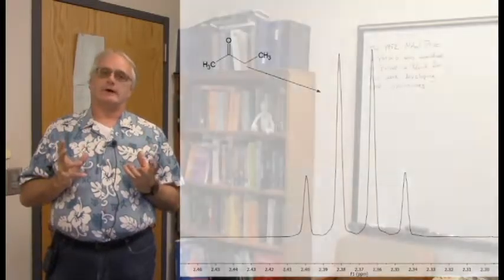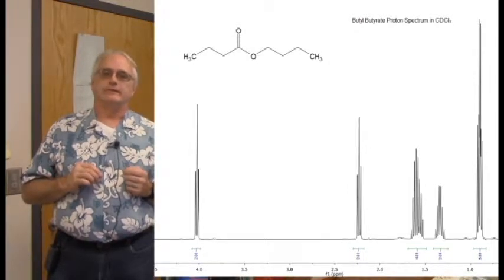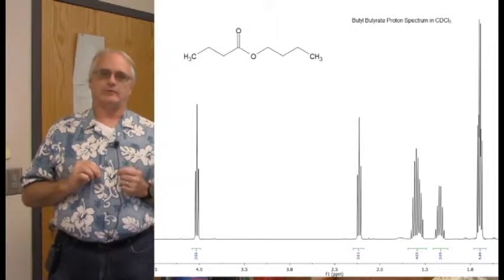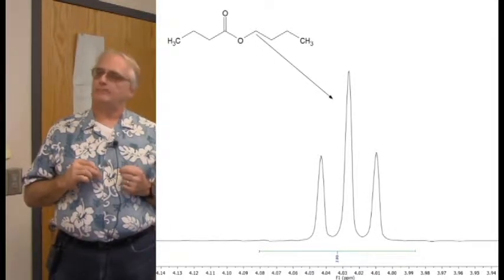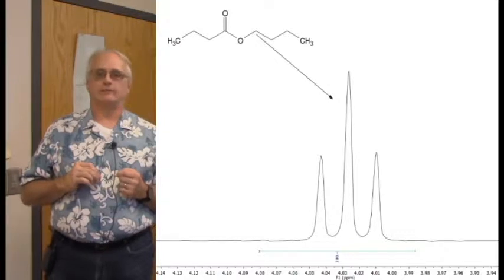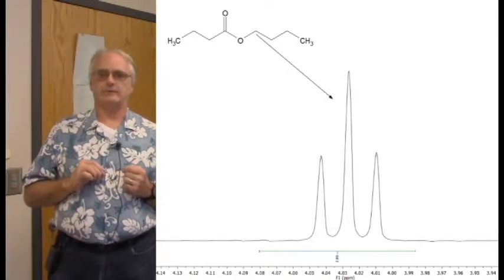And even in larger molecules, the somewhat larger here butyl butyrate, 5 methylene groups in this thing, and a number of them are exactly what a textbook would tell us we ought to see. For example, this one over here, CH2 group, a methylene, right next to the oxygen of the ester. There it is, right over 4 ppm. It has 2 neighboring protons. It is a glorious textbook triplet.